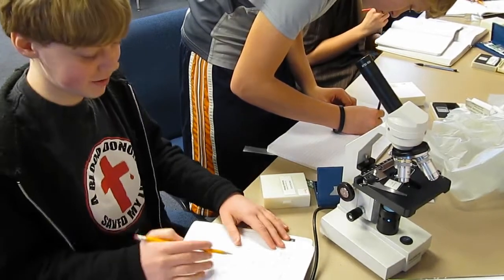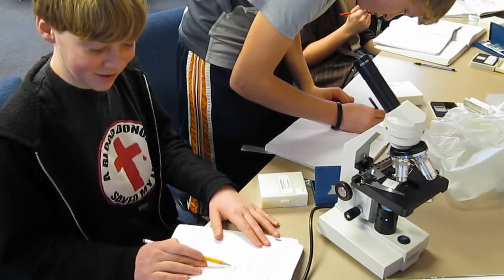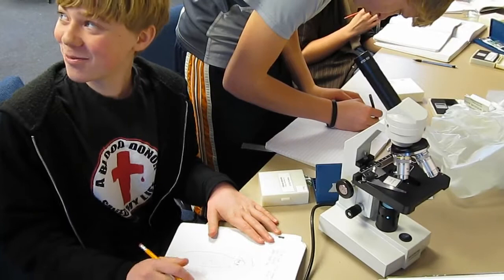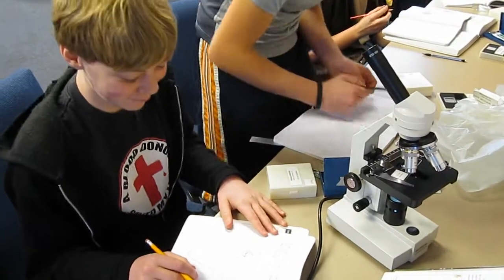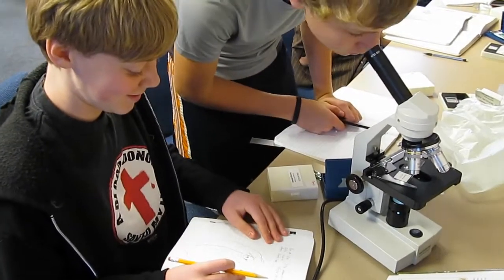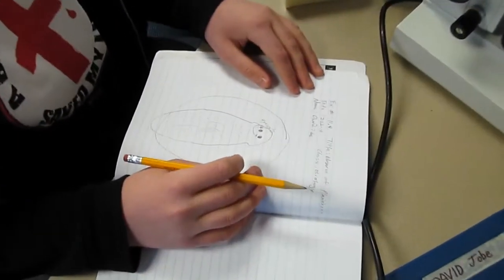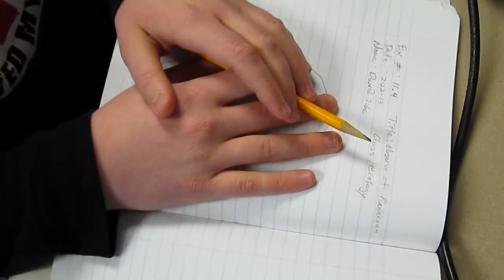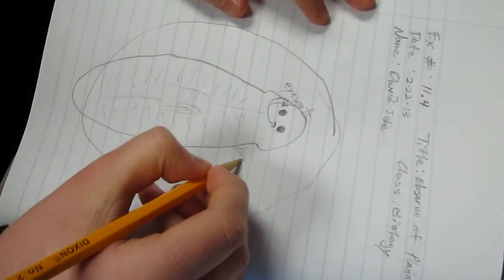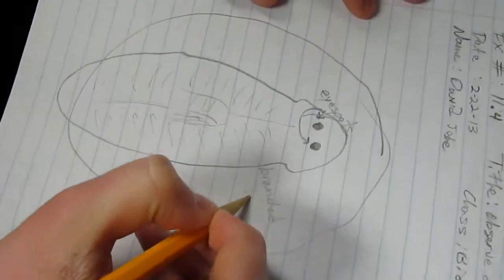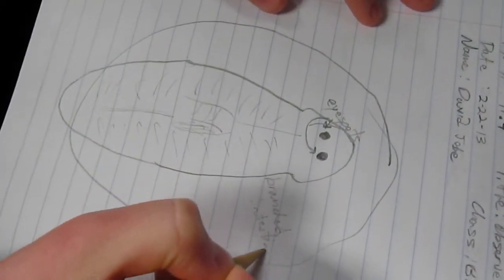He's alive, he's got eyes. It's just an arrow but it looks like a mouth. Let's see. Does he got a spine? It does look like a smiley face.